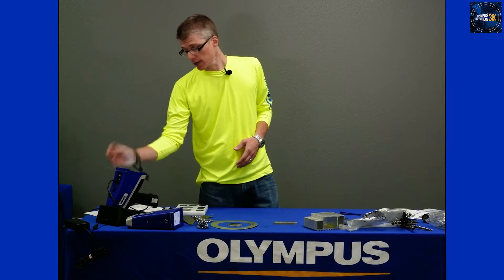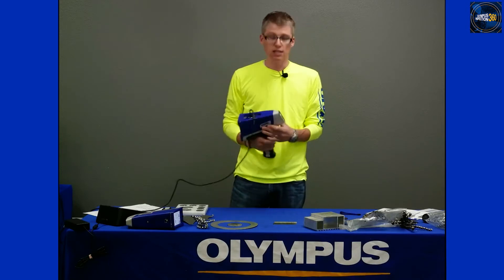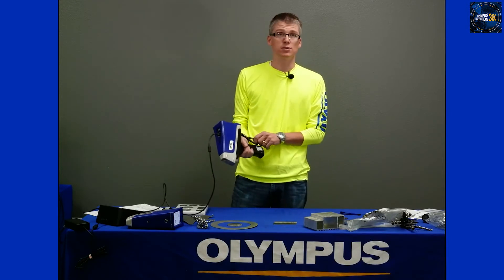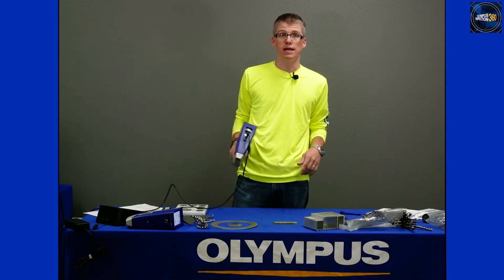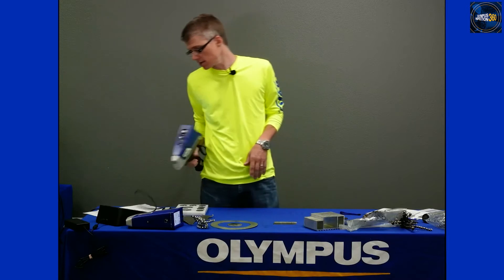Another thing I like when I'm out in the yard is to put on a wrist strap. This helps against drops and damage. The instruments do have a military standard four-foot drop test, but that wrist strap goes a long way to keeping it in your hand throughout the day. You can get holsters, but at the very least I like to have that wrist strap.